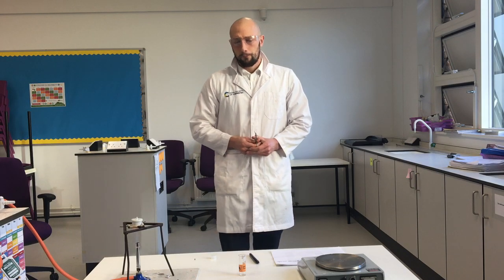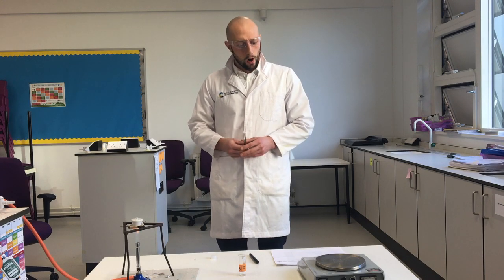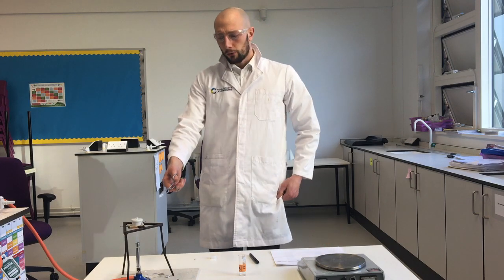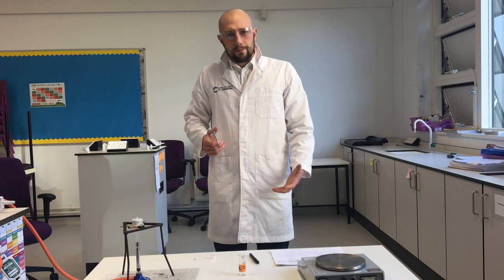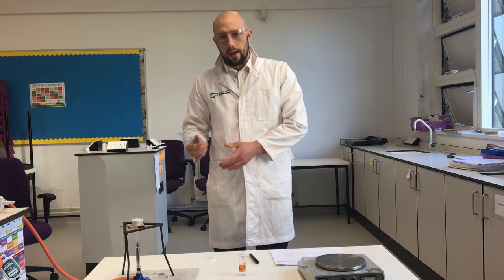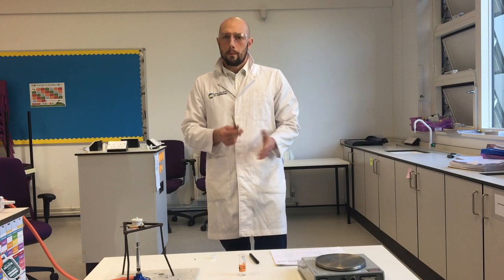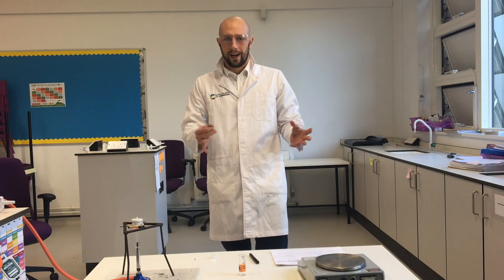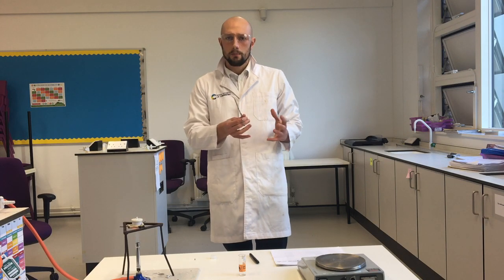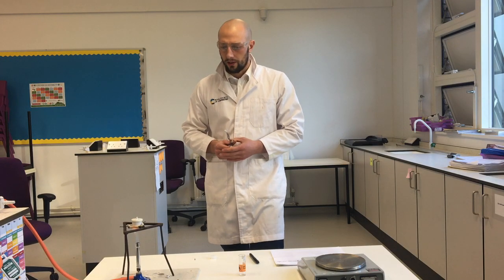Now what we're going to test is how much oxygen reacts with the magnesium. That's why I very carefully measured 0.3 grams of magnesium, put it in my crucible and started heating it. When it gets very, very hot, it will react with the oxygen and form magnesium oxide. And then I can weigh the magnesium oxide again and see what mass I've got. We know that the mass of magnesium and the mass of oxygen that react together will make the mass of magnesium oxide. All of the atoms come together to make the product. So we should be able to see how much oxygen has reacted with the magnesium.